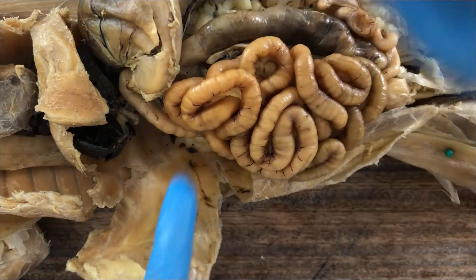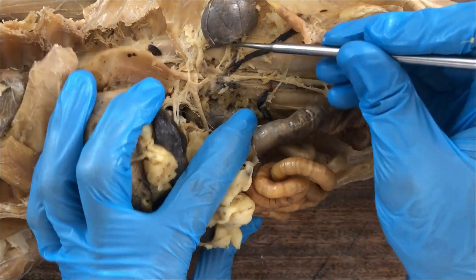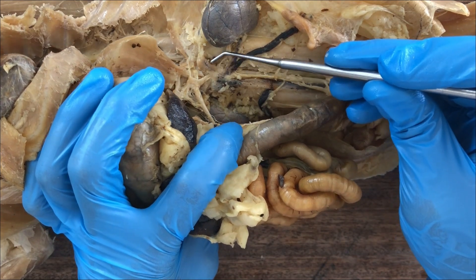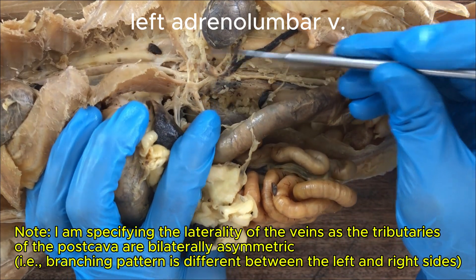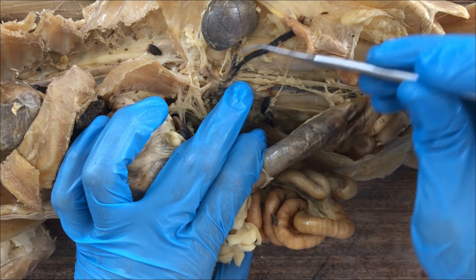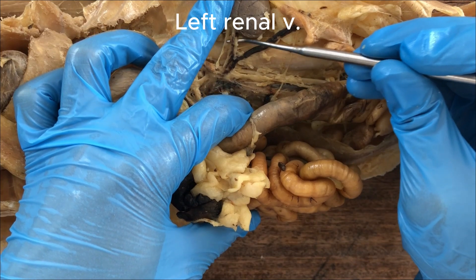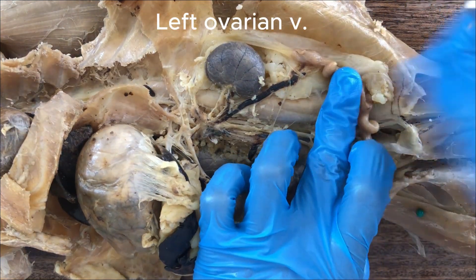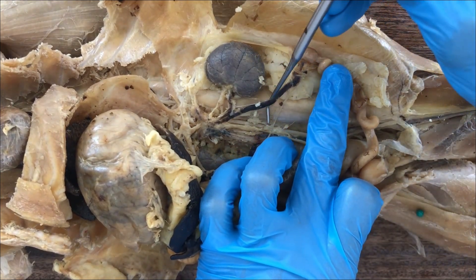Let's trace the lateral tributaries of the post-cava. One of its first tributaries in the abdominal cavity is this small adrenal lumbar vein, passing over this nut-sized organ called the adrenal gland. Then immediately posterior to it you'll see the left renal vein, and then there's a left ovarian vein — so this is a female specimen. If you have a male specimen, this one will be the left internal spermatic vein.